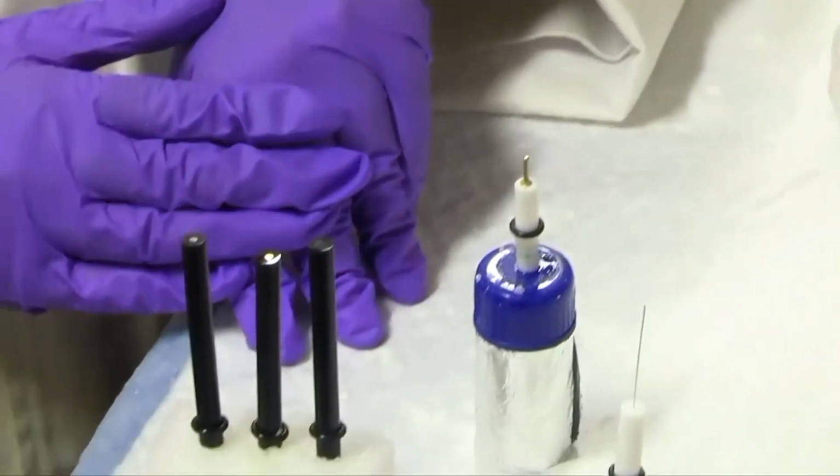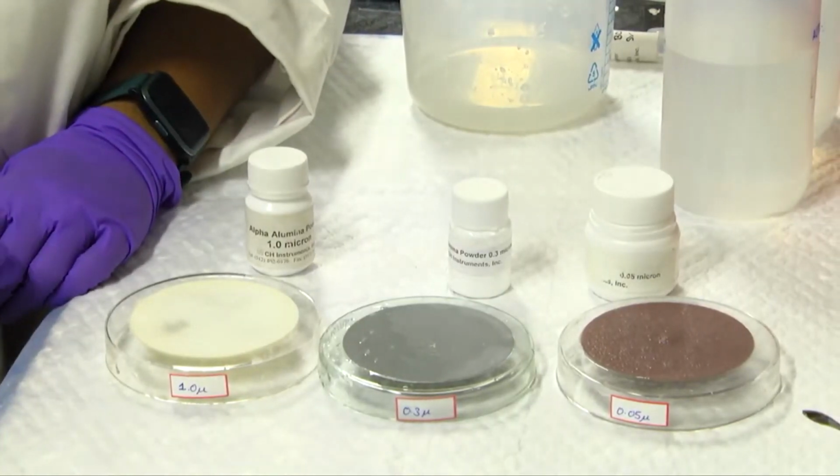Now we will be demonstrating how to clean the working electrodes. Electrode cleaning is a conventional procedure that is widely utilized, especially for analysis in disc electrode applications. It involves mechanical polishing, gentle washing using ultrasonication and DI water, and electrochemical pre-treatment. So we will be demonstrating mechanical polishing, ultrasonication in deionized water, and acid treatment, following which we will be demonstrating the electrochemical experiments. So now we will be doing the mechanical cleaning of the electrodes.